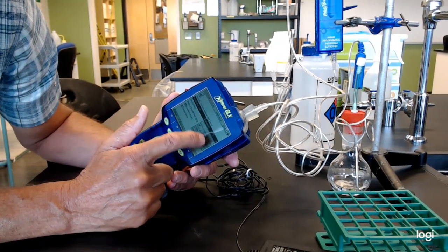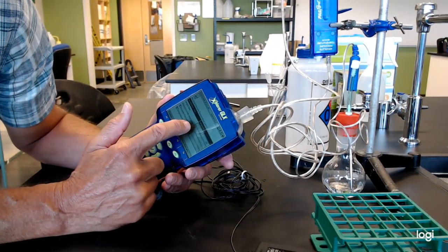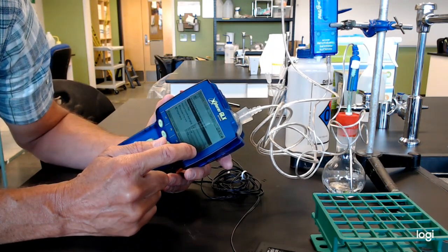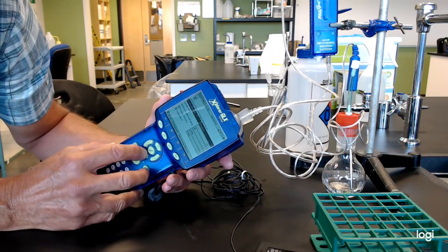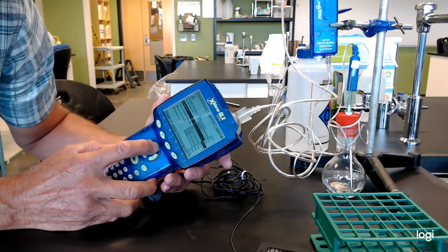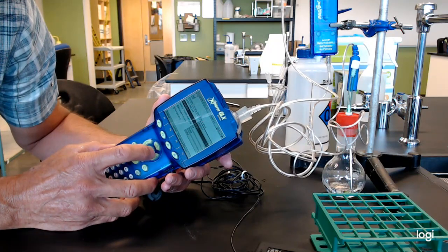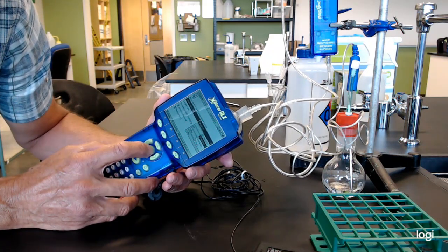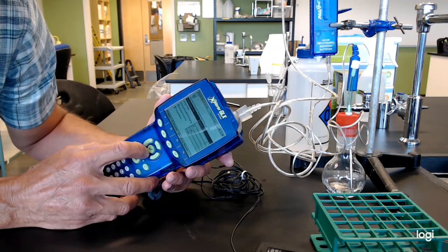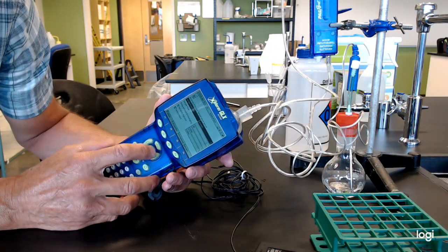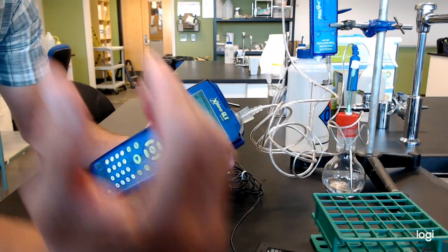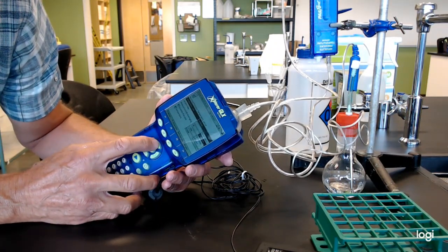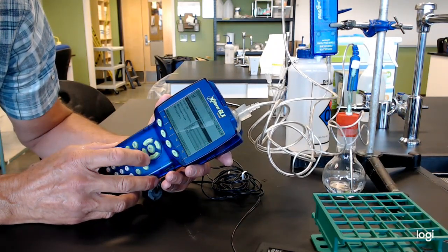Right in here, you can see the sampling rate. It says samples per second and the sample rate is 10. That means it's taking every second 10 data points. That's going to fill up a lot of data. So if you want, you might want to scroll down there, pull that down, and maybe make it one per second. Or if you want, you can change it to seconds. Then that means one sample rate every second, and you can start changing the number and get two seconds in between sample rates. We'll just get one per second. That'll be reasonable.